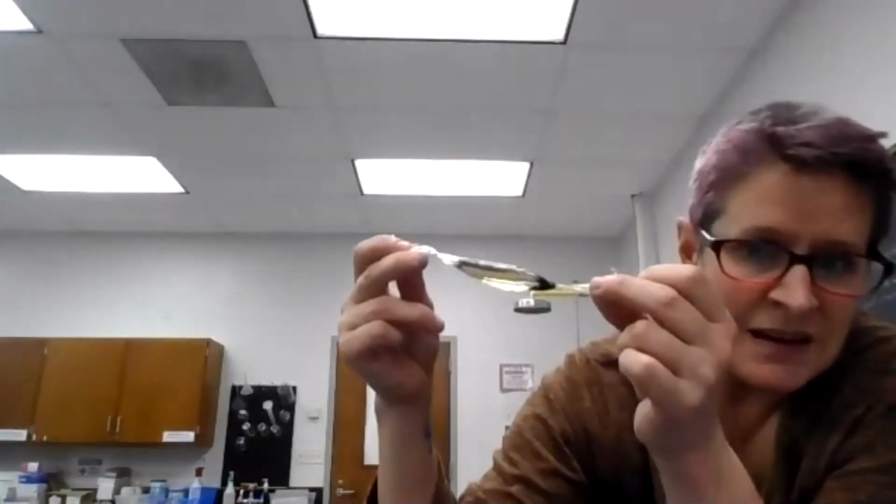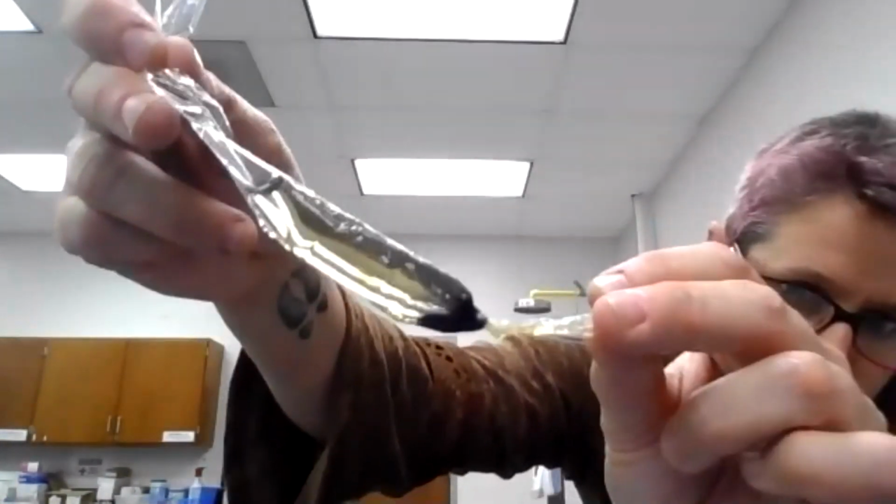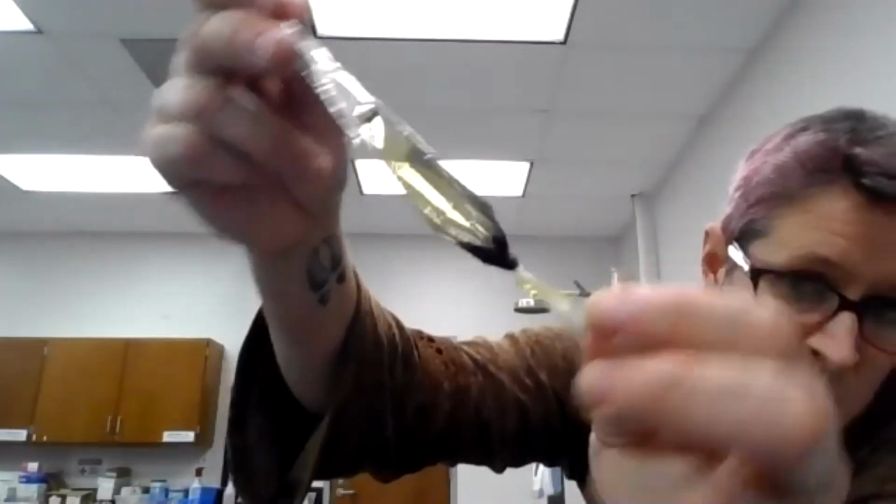Here's the answer. The water was pure tap water at the beginning of the experiment. Now, by osmosis, water wants to cross a membrane to where particles are in high concentration to dilute those particles. So water from the beaker entered the bag by osmosis and carried iodine with it. And when that iodine came in contact with the starch, it turned it blue because iodine's an indicator reagent. So we have confirmation that osmosis occurred. Okay, so that's one passive transport.